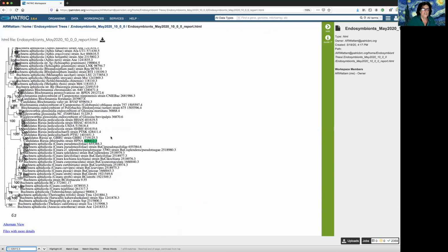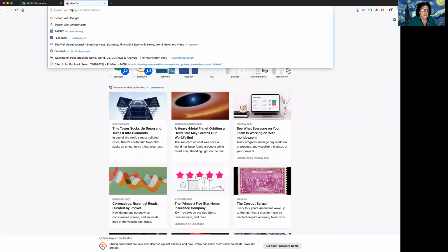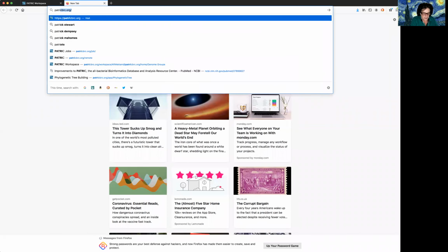So how do I fix those things? How can I improve the tree? How can I get rid of those things? Do I have to add all of these things at once? That would be a nightmare. So I'm going to show you how we can do this. And I'm going to open a new tab and go back to PATRIC.